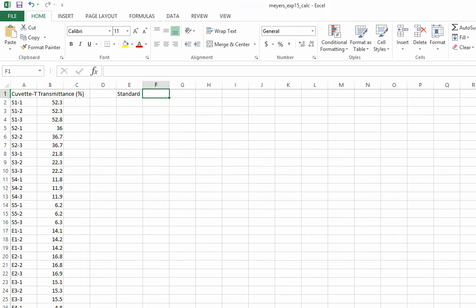The first table comes directly from the lab manual. It should contain the name of the standard and the volumes of chemicals added. Our standard solutions are made from 1,000 microliters of iron nitrate, variable amounts of sodium thiocyanate, and variable amounts of water. I can carry values forward by clicking and dragging the bottom right corner of the cell.